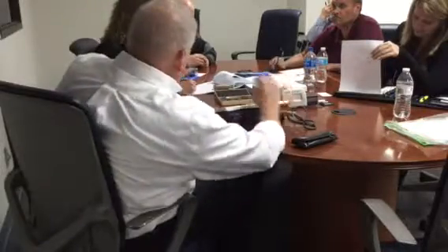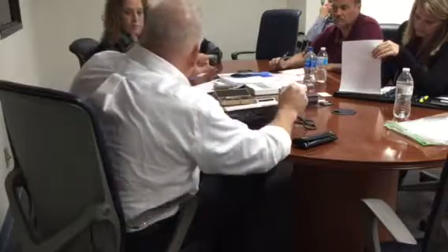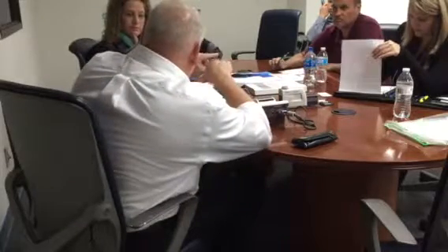Your range, and this is unique to Mitutoyo as of today. Their competitors are trying to catch up. But range is the measuring envelope of this stylus. You have an 800 micron measuring range. Your stylus will move 800 micron.